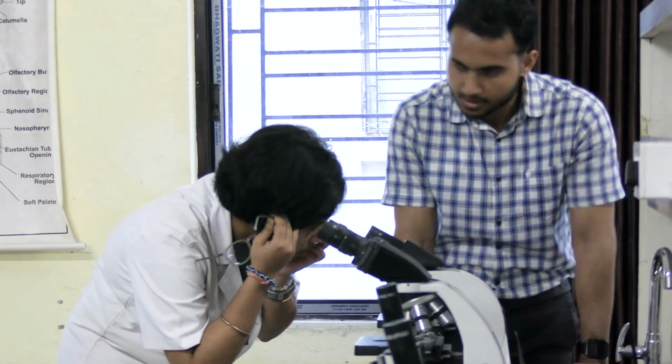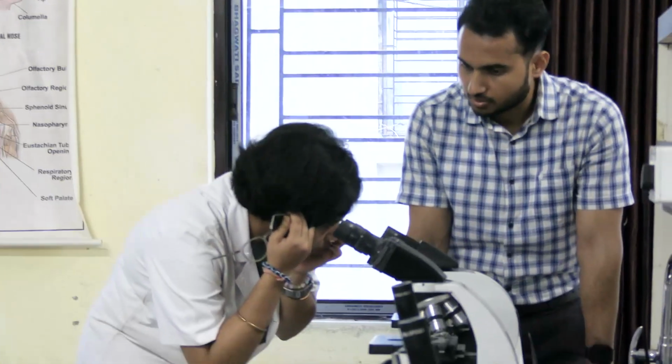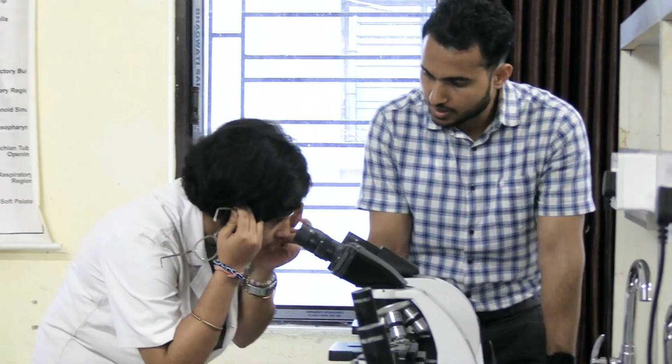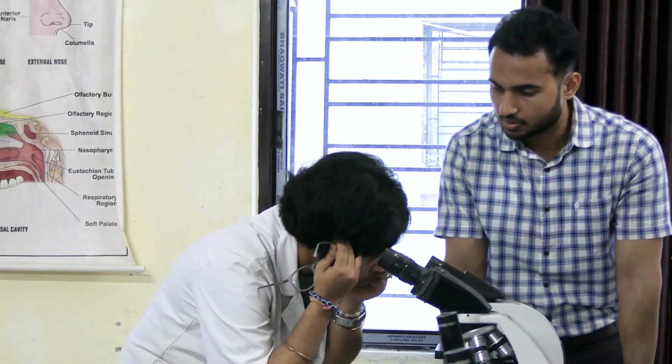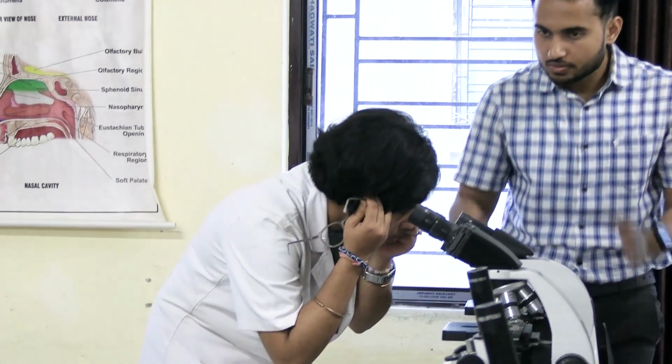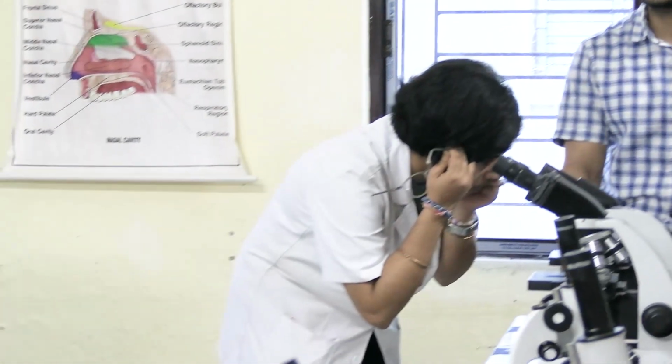Yeah, perichondrium is present in both the cases. What else can you see? Yeah, lacuna is there. But in this case, the lacunae are larger. Please focus on the lacuna. Okay, and then you will be able to see only one chondrocyte inside the lacuna. Next, in between the lacunae, you can see these wavy type fibers. These are nothing but the elastic fibers. I hope it is visible. Okay. So this is how you have to identify the elastic cartilage.